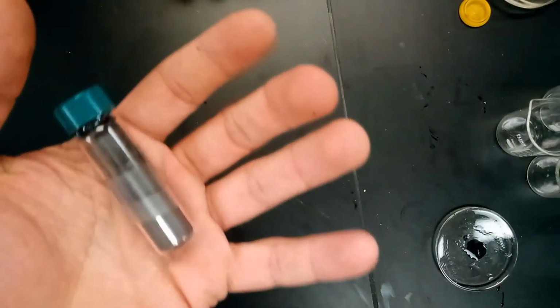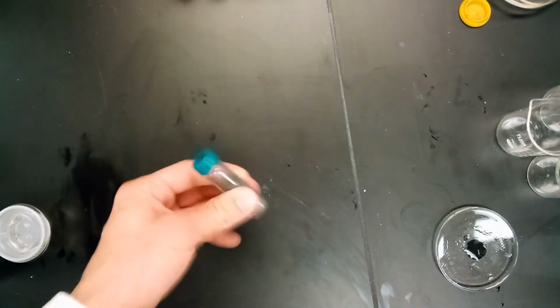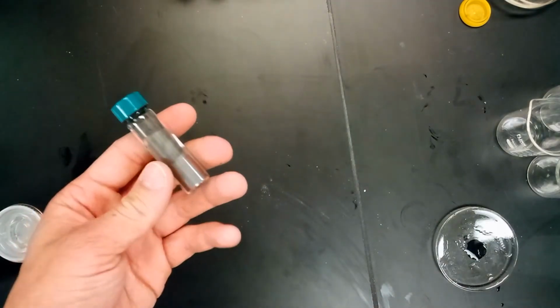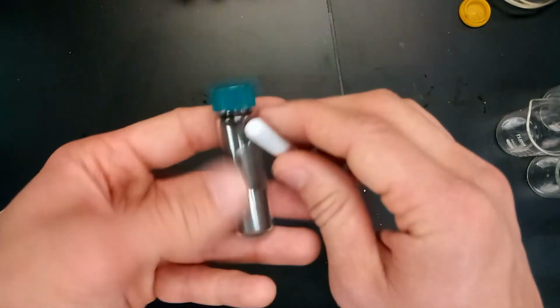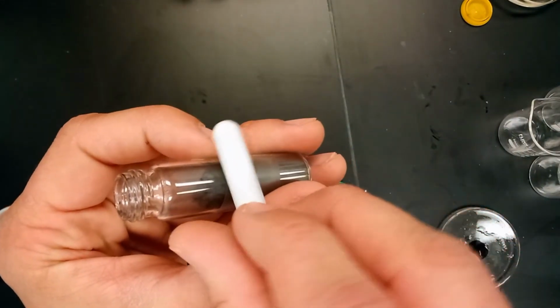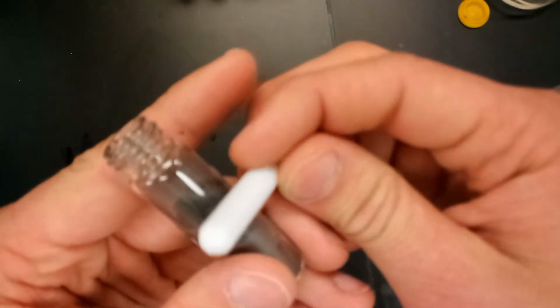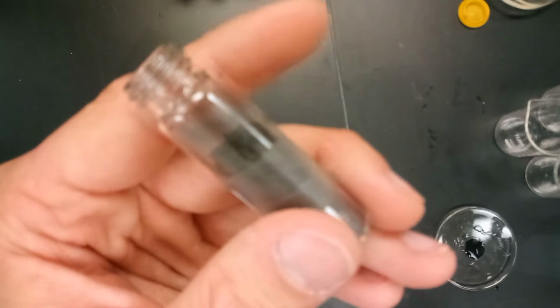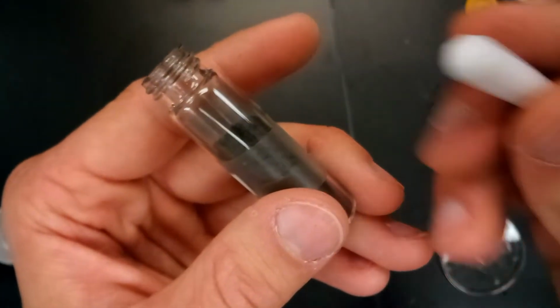We're going to go ahead and work with number 6 here. It's a metal that's a powder. It's a powdery-like metal. There's really 2 things we're going to test with this one. We're first going to test magnetism. So, I don't know how well you can see this, but if you look on the side here, we're going to draw the magnet across it. And the powdery metal does not seem to be magnetic. Oh wait, I just realized the camera was sort of out of focus, so we're going to fix this and do it again.